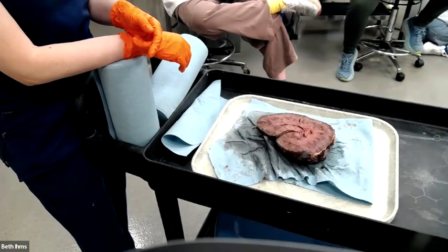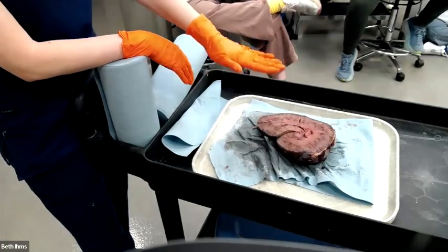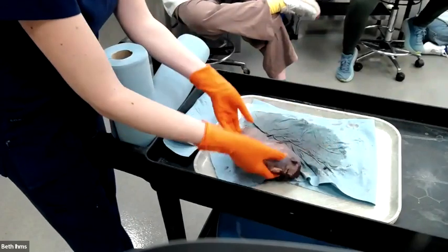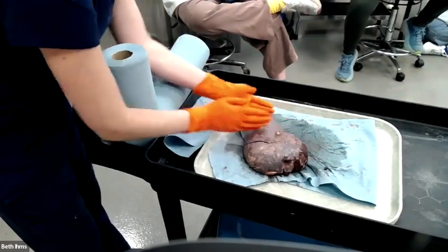It's both. The dots are all over the kidney, and I'm looking at how much normal kidney tissue is here. There's normal kidney tissue in between all the dots. If I could take all these dots and put them all together over here, it would be about this much of the kidney.